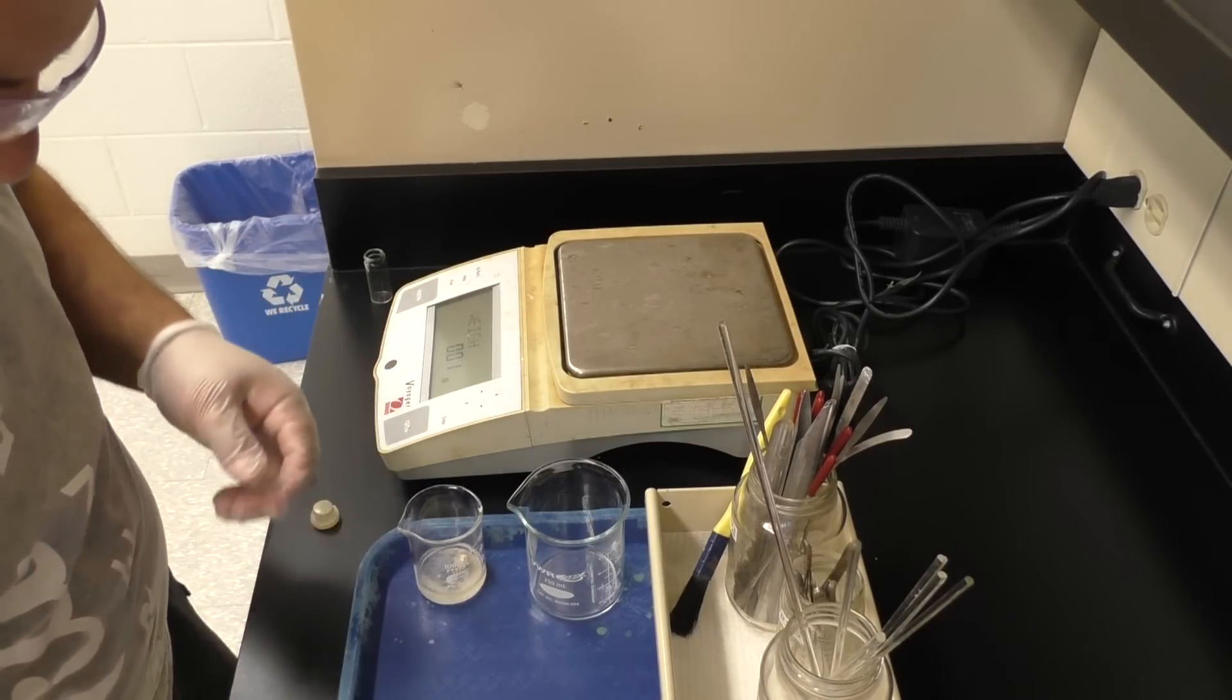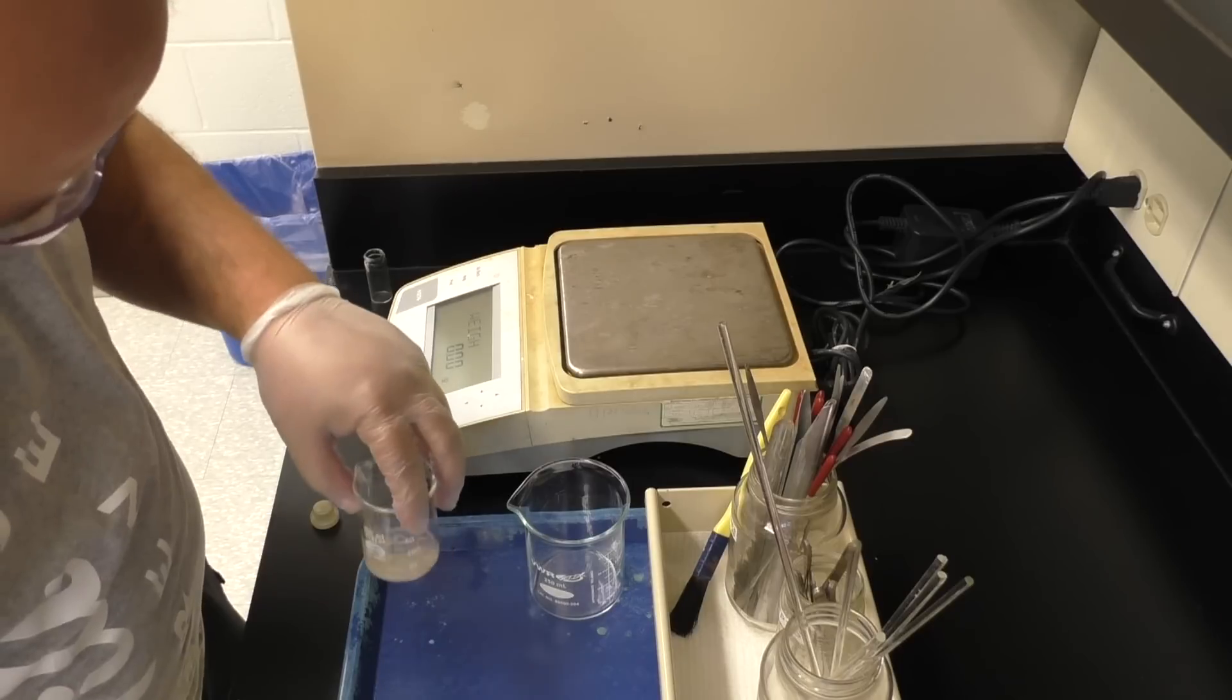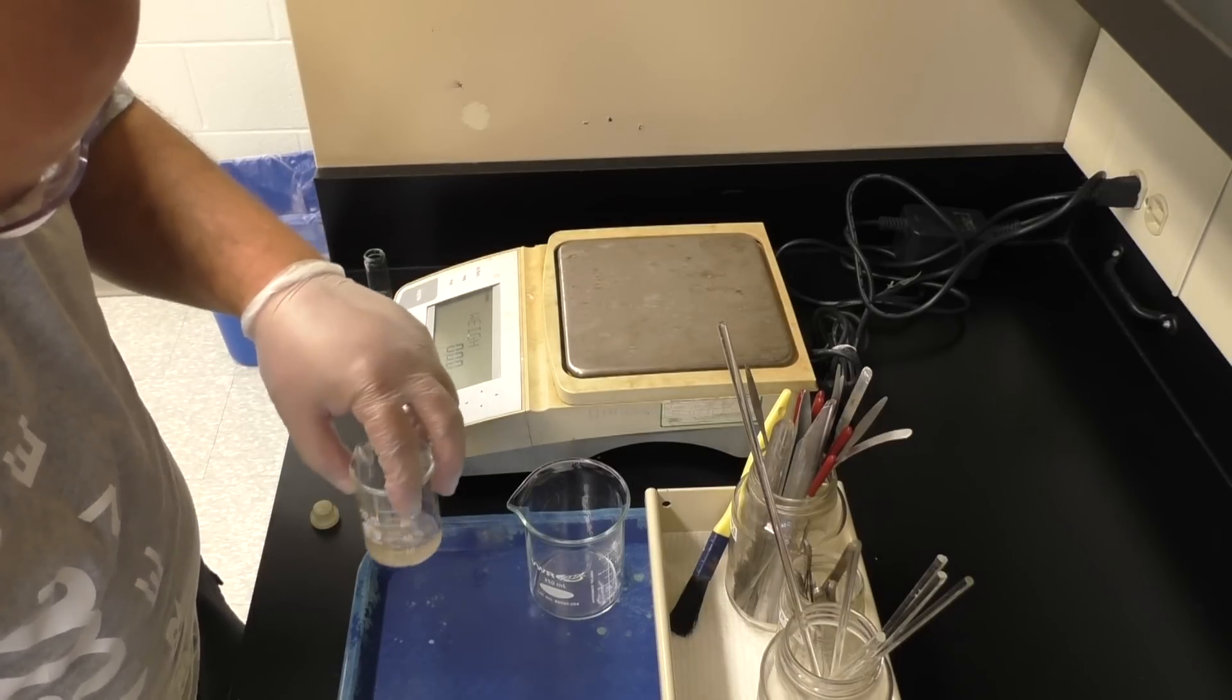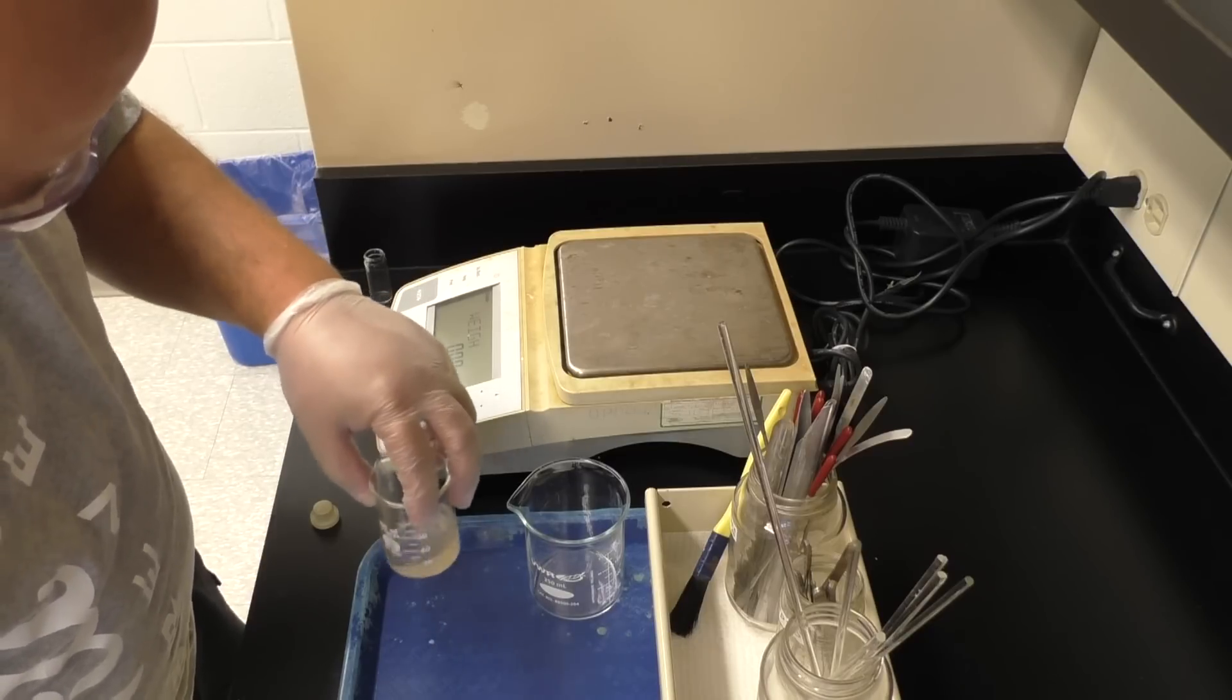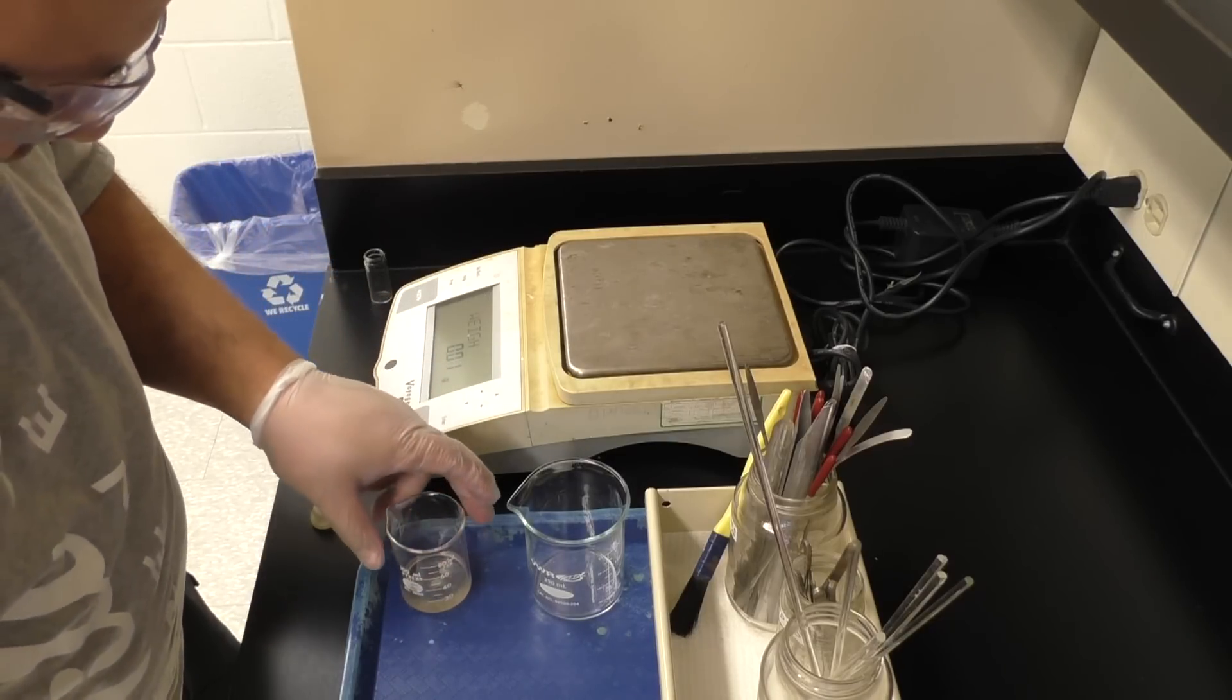Then as far as the lab goes, the next thing you're doing is adding ether, more of it to dissolve your solid. And note here, you're looking to dissolve over 90% of it.